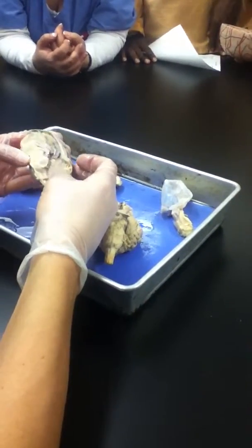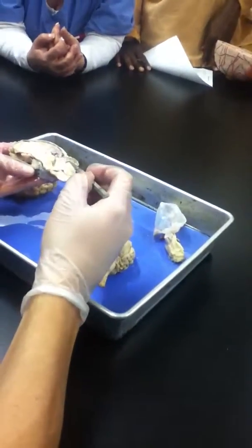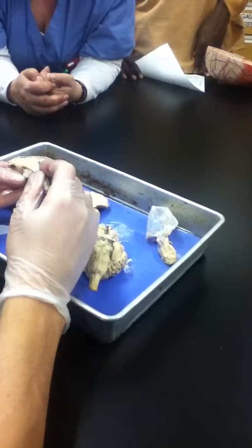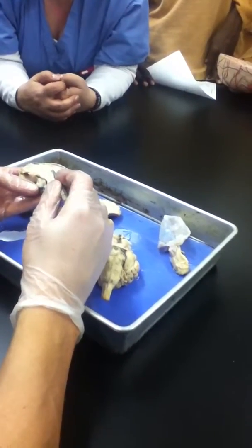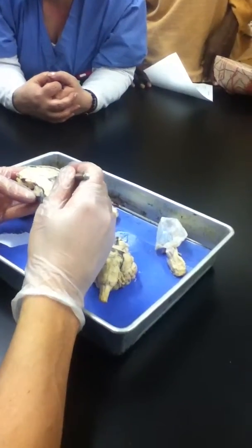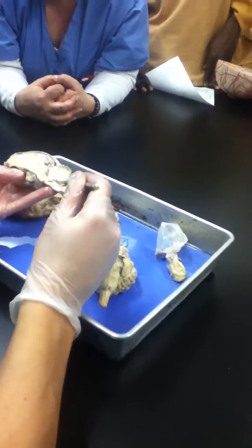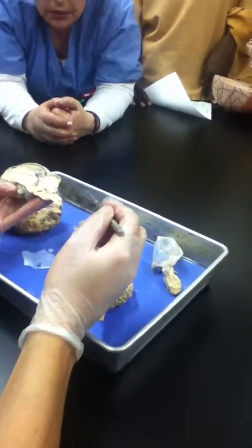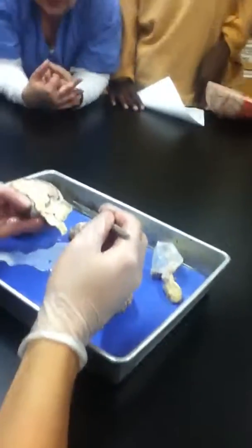All right, so I'm pretty sure that's all the details from this angle. So from this angle, again, it's the white matter structures, like here, arbor vitae, and this white matter structure here, corpus callosum, and then all the spaces, lateral ventricle, third ventricle, fourth ventricle, and the central canal of the spinal cord. Good. All right, that's it for sheep brain.